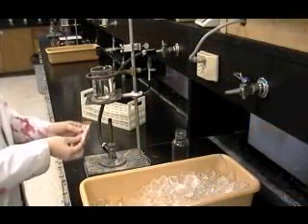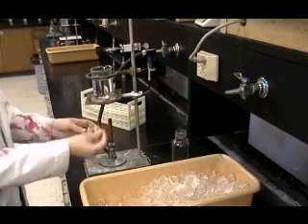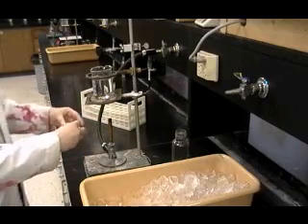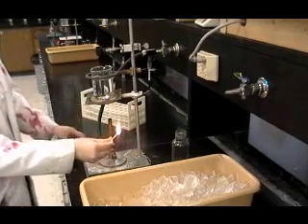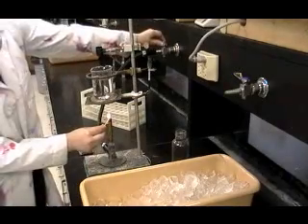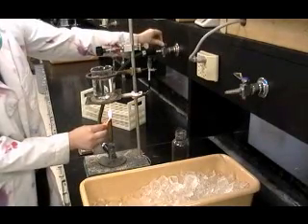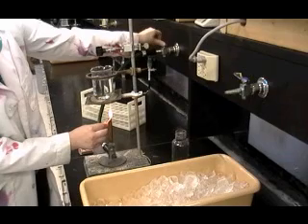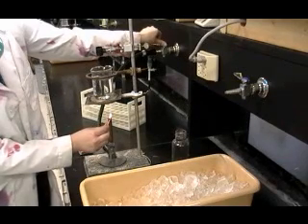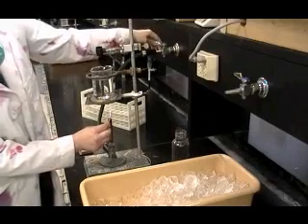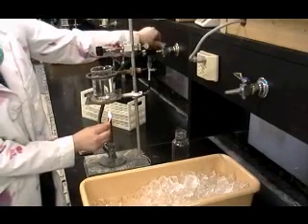In step 2, you will need to bring a 250 milliliter beaker filled 3 fourths full of tap water to boiling. Start by striking a match away from yourself and from others and hold the match up to the side of the Bunsen burner. Turn the gas on slowly and make sure that the tip of the inner blue cone is at the bottom of the 250 milliliter beaker.